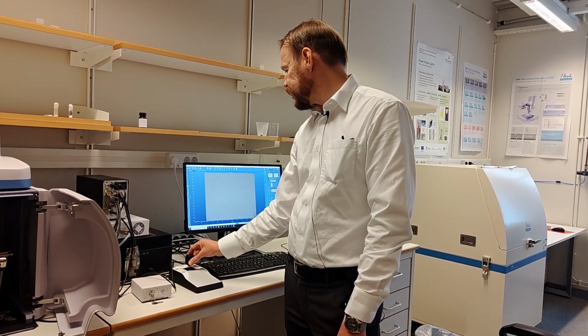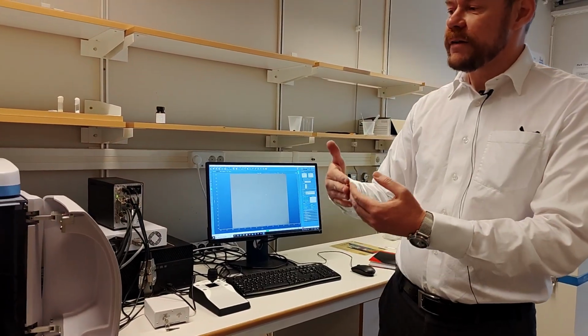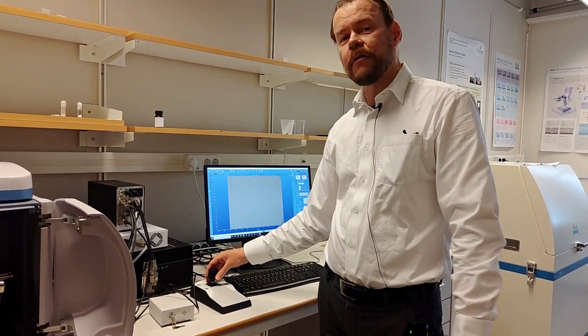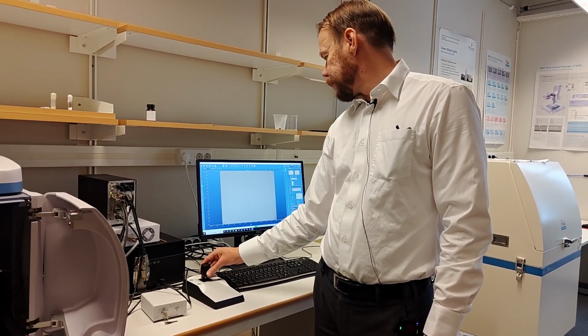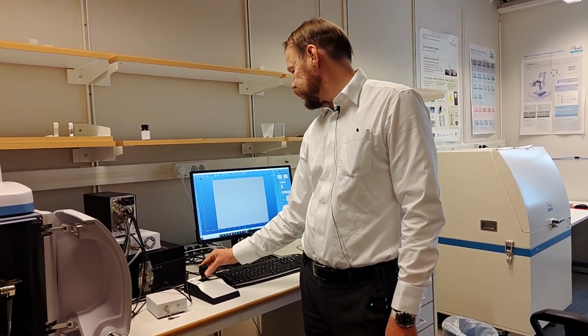Yeah, and then we see that I fail. You see it starts becoming dark. That means we're coming completely out of focus. So that means I need to try clockwise this time. There we saw something.